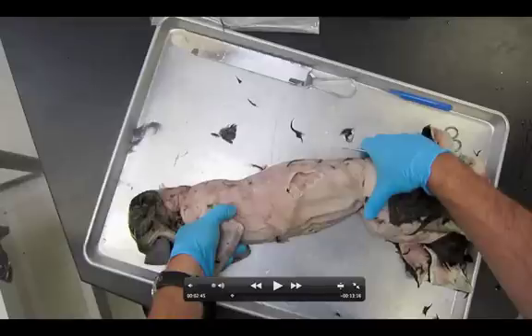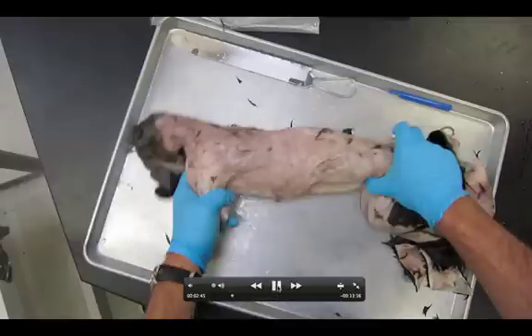One important thing to notice: the margin is going right here, and we've kind of freed up a piece of it right there. We're going to free ourselves from here all the way down to about here. Do not go anywhere over there — not good at all. Only along this one single margin right there. Let's watch as we try to get underneath this latissimus dorsi.